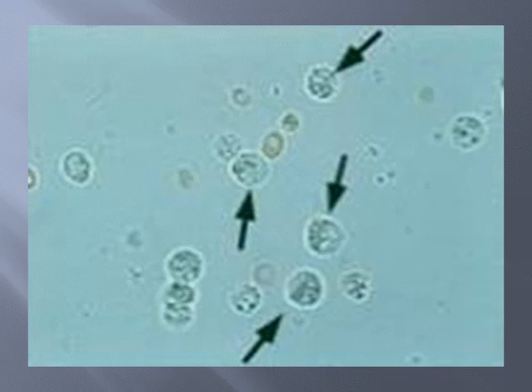Here's an image of some white blood cells in urine, and remember, between white cells and red cells, these are going to look kind of granular due to the nuclei and the granular composition of white blood cells.